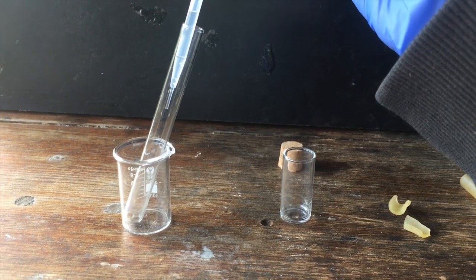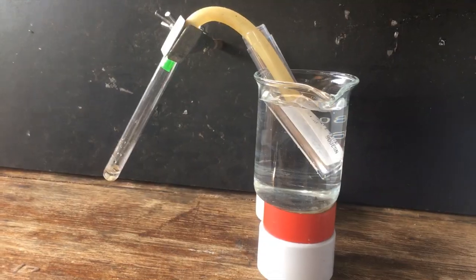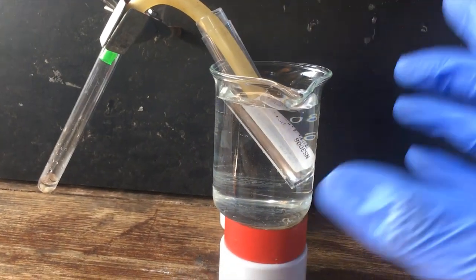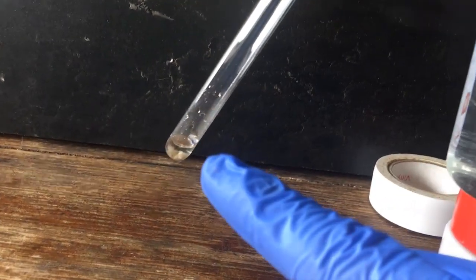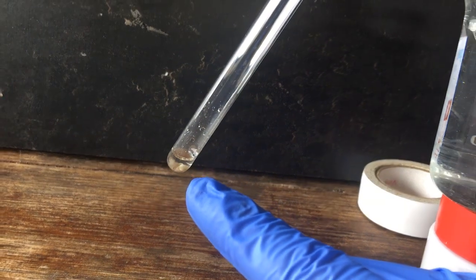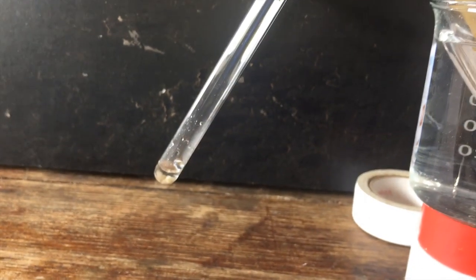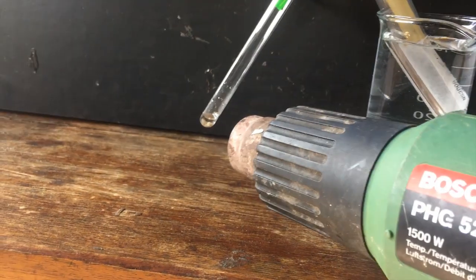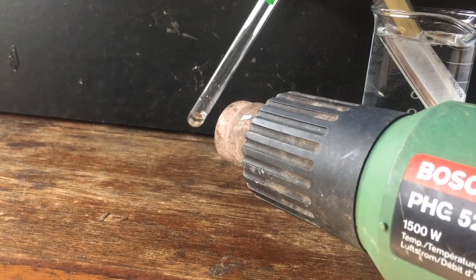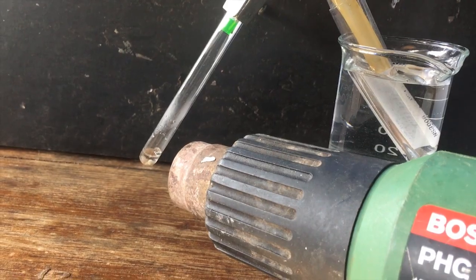where we'll be doing the boiling. So that's all set up and ready to go. We've got our collection flask in some nice cold water here. We've got our condensing tube, and we have all of the heavy water we've collected in the bottom of this test tube here. You can see I've got some grains of sand in there to act as boiling chips. I'll just go ahead and grab the heat gun and we'll heat that up. We'll get it to boil, and then we should get some heavy water condensing through that tube. Easy enough.